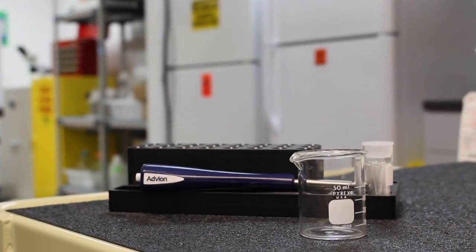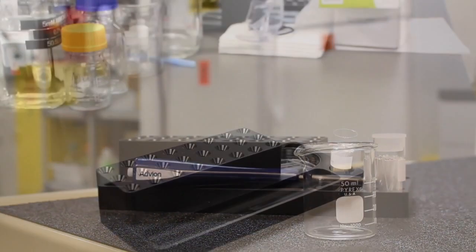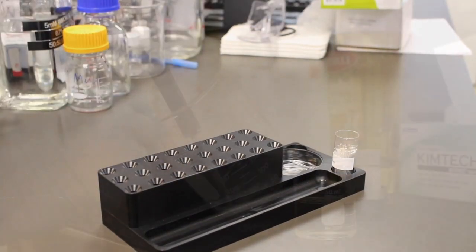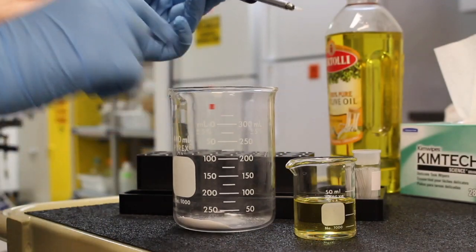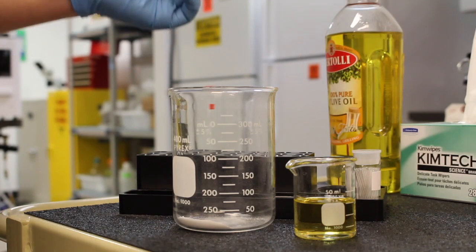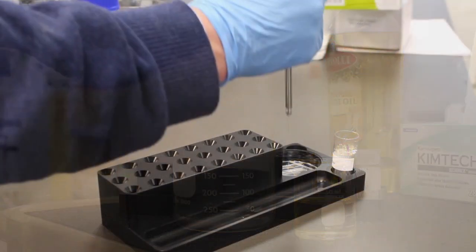Involatile salts and buffers are left on the probe, avoiding contamination of the mass spec. Cleanup and analysis is a single step. You are then ready for your next sample. Simply clean the capillary or use a new one.